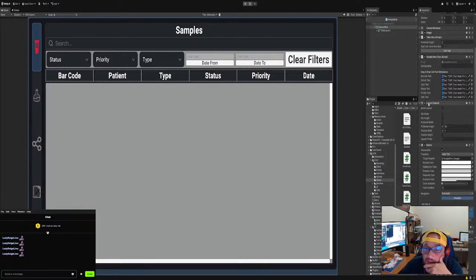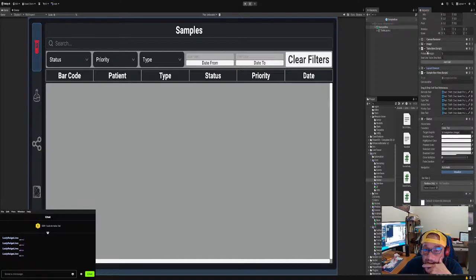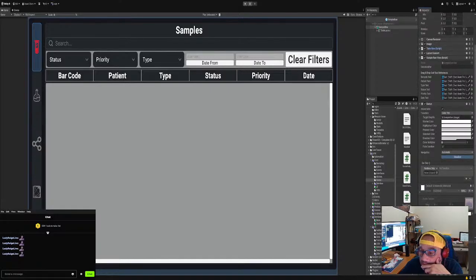I'm gonna move this up just to get out of the way. This is just passive. All right. So we're gonna use the event bus like we always did. We wrote the event bus for this, but I wrote a specific one. Let's see, I wrote my notes here. Sample row click event, published when a row is clicked.